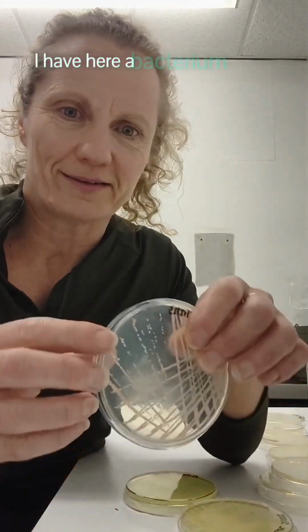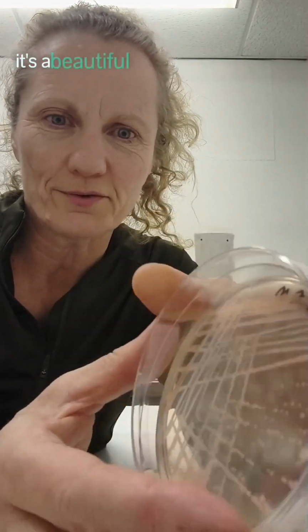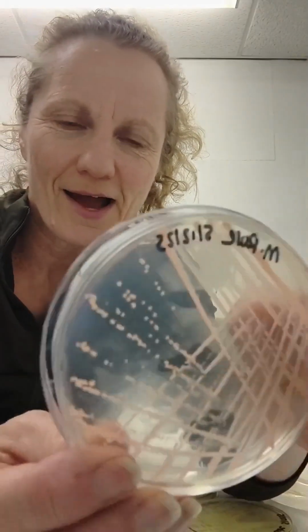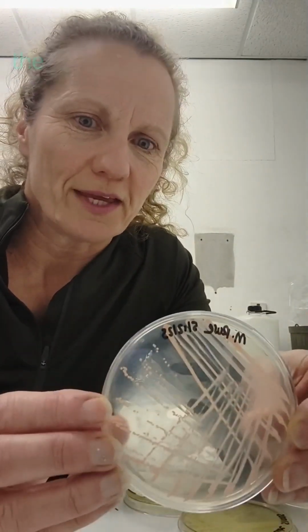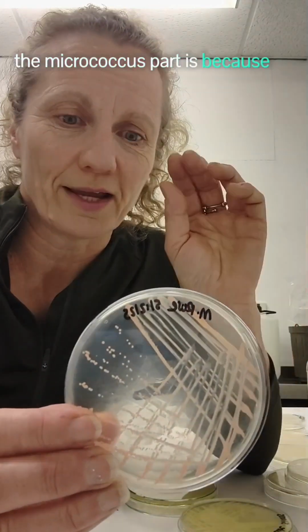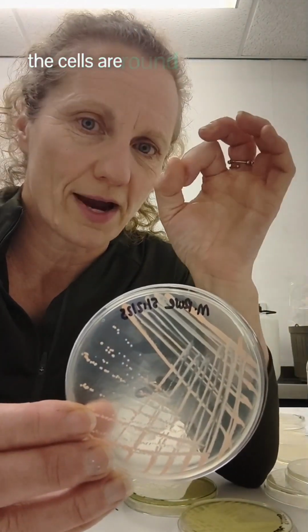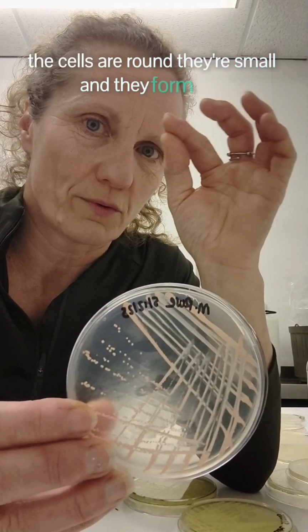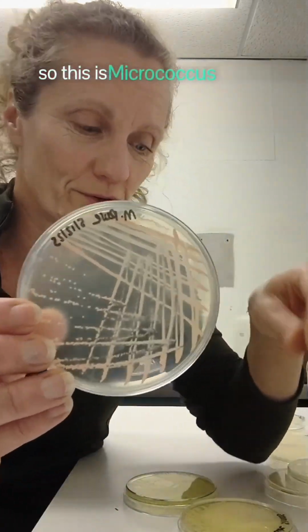I have here a bacterium called Micrococcus roseus. It's a very small colony, but look, it's a beautiful pink colour. Isn't that lovely? So that's why it's called Micrococcus roseus. It's a rose colour. The micrococcus part is because of the way it looks under the microscope. The cells are round, they're small, and they form little clusters of 4 called a tetrad. So this is Micrococcus roseus.